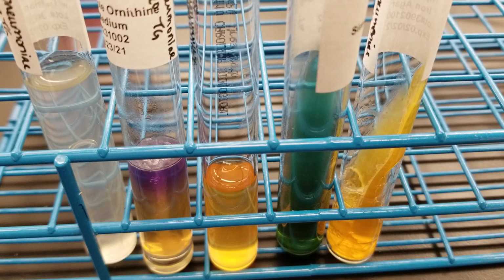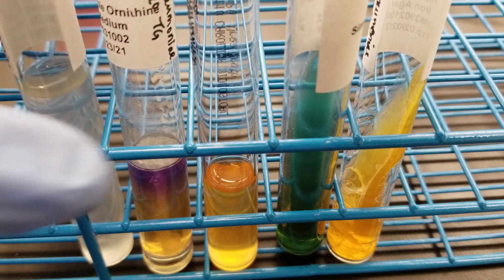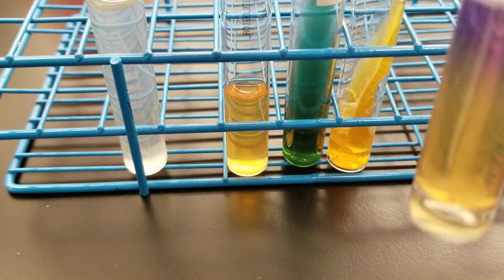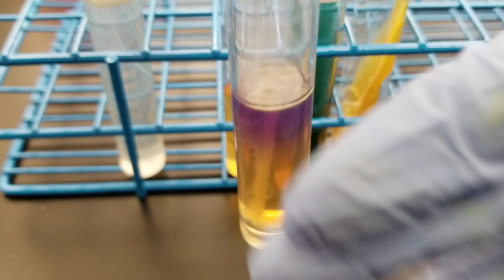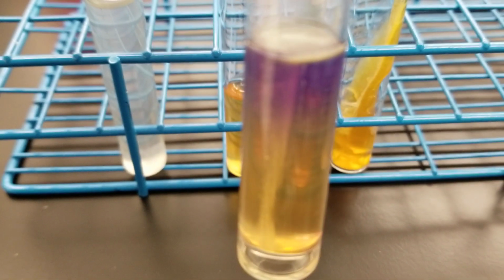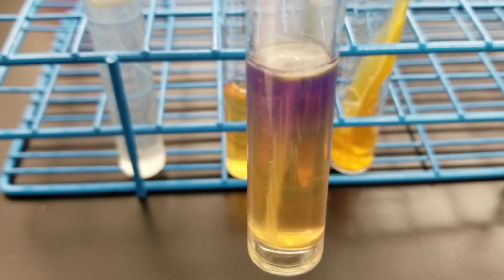Okay, we're going to add our drops. 1, 2, 3, 4. You can do 3 or 4. Either is okay. Putting the top back on, and we're going to look for that pink, if there is pink. But we should be seeing yellow, right? Because it's supposed to be negative, negative, negative. And there's that yellow. It's turning yellow. So it didn't go away from the stab line. This is a very good picture of how clear it is. It's not going away from the stab line, and it's yellow.